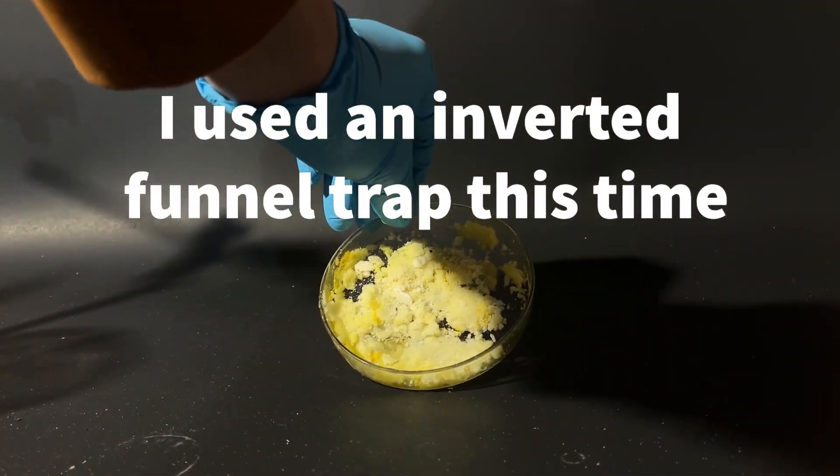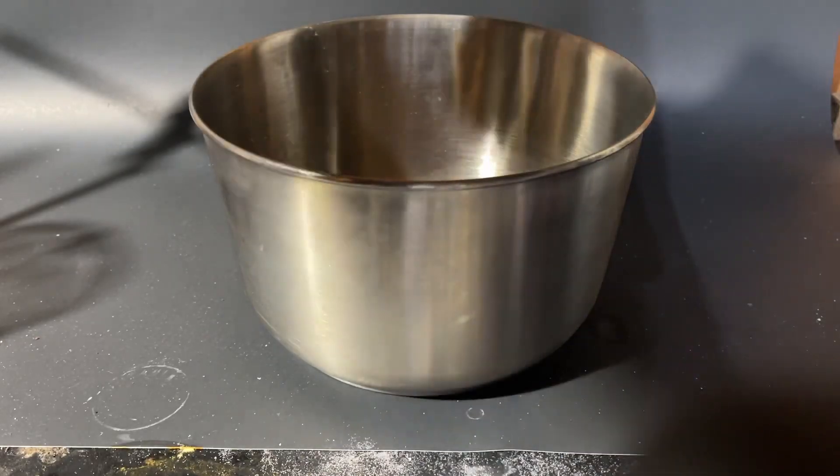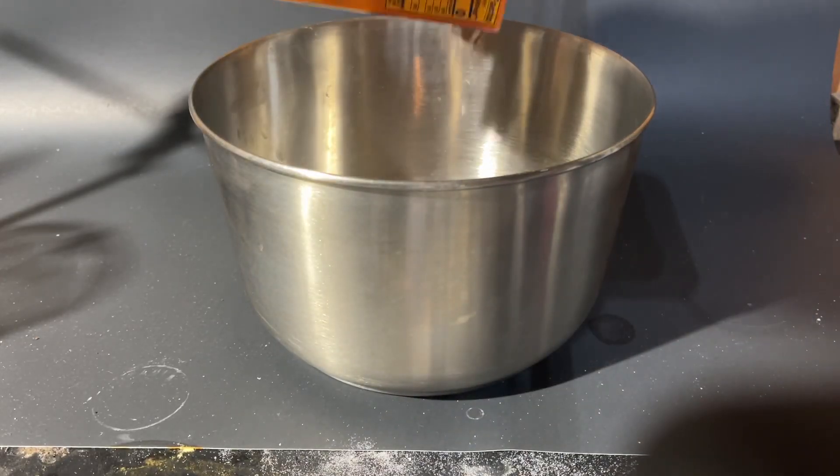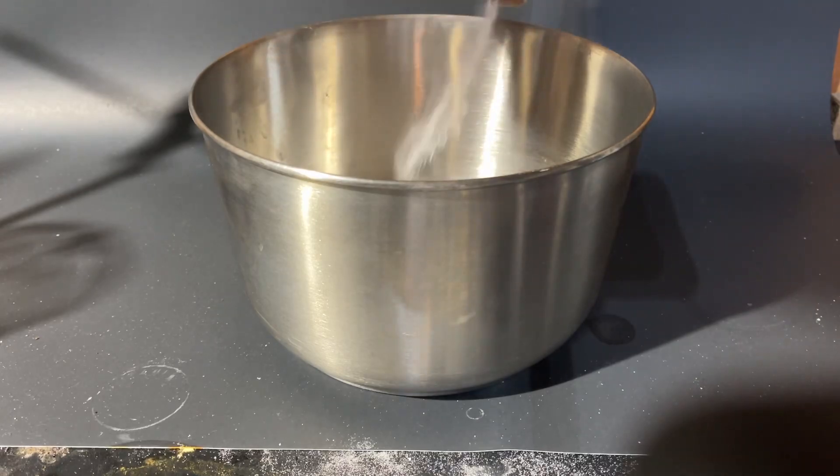Okay, now to making the actual smelling salts. For this step, I need sodium carbonate, and you may be thinking, well, that's just baking soda. No, my friend. Baking soda is sodium bicarbonate.